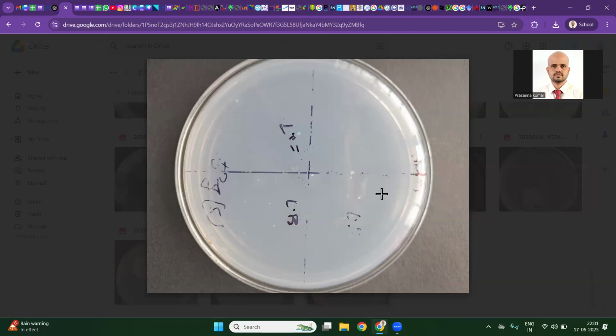Are the colonies emerging away from the explant? Any colonies that are emerging away are not to be considered as an endophyte; they are actually an airborne contamination. Did the imprint plate show a similar contamination? If the colony morphology of the imprint coincides with the explant, you need to ask the question again: is it really an endophyte?